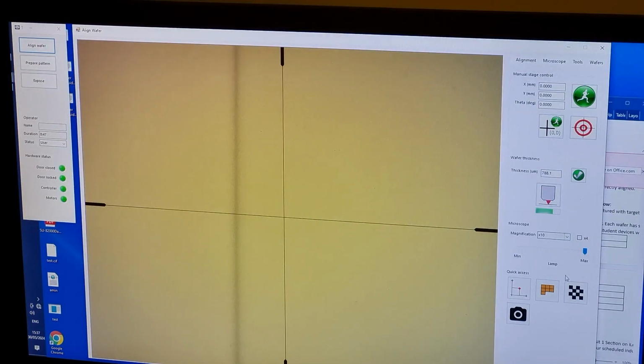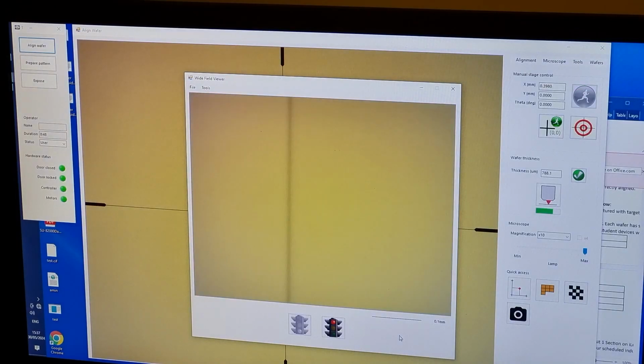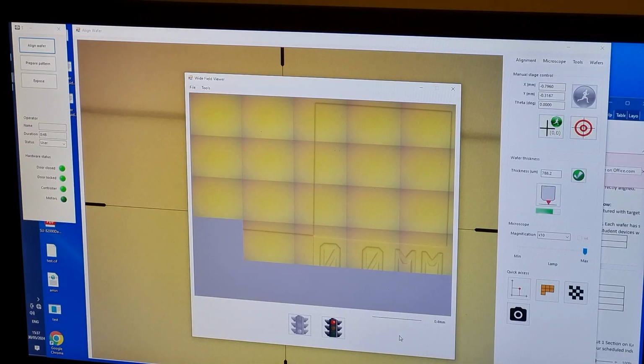We begin the alignment process by finding layer 1 alignment marks and entering their expected positions. Our first layer has 3 alignment marks located at XY coordinates of 0, 0, 27, 0, and 18, 0. The orange tile button launches a feature that makes it much easier to find alignment marks. It does this by spiraling outward, taking pictures as it goes, and adding them to a mosaic image with a larger field of view. It allows us to find the center of the alignment mark without much effort. Double-click on the center of the mark to move the microscope to this position.